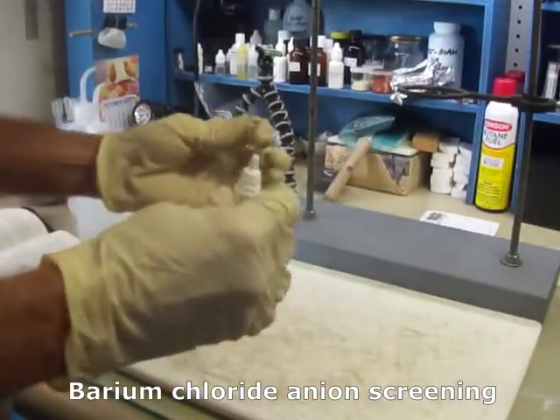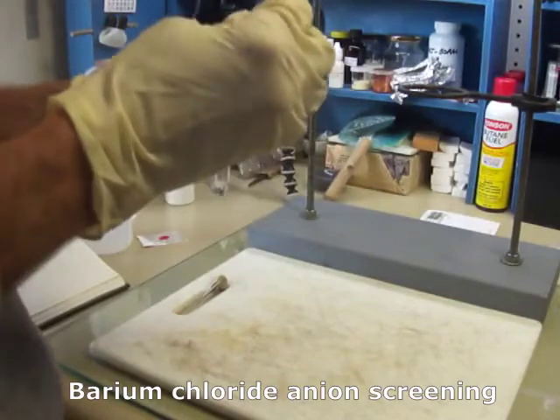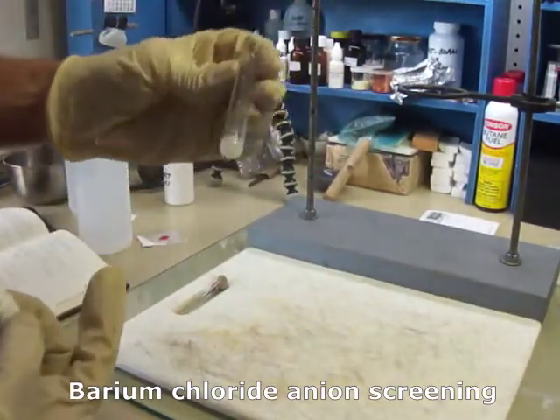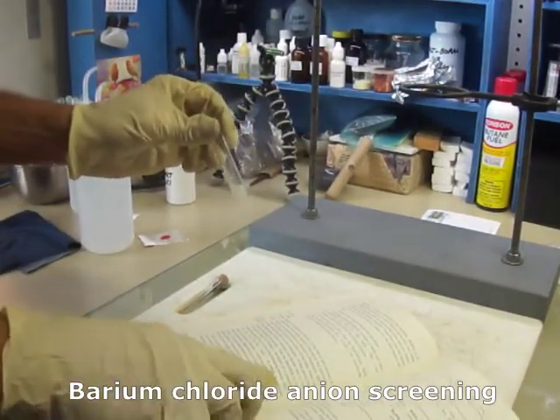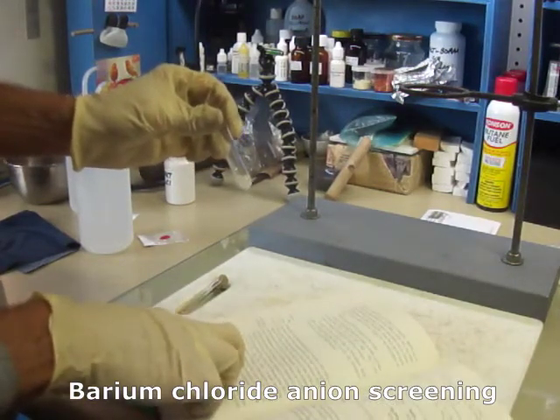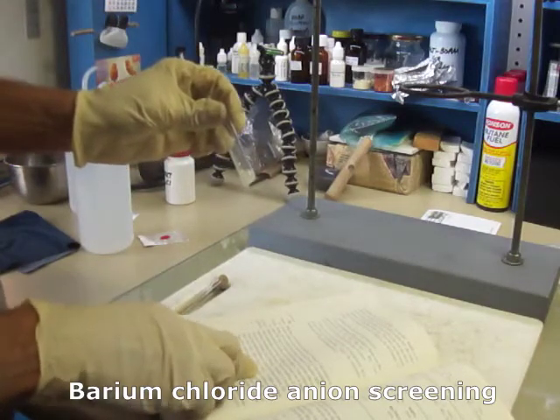Now we add a drop of barium chloride and look for a precipitate. Oh yes, we have one. And it's white. If it was a yellow precipitate, it would be chromate. But since it's white, it's either sulfite, sulfate, carbonate, borate, phosphate, or arsenate.